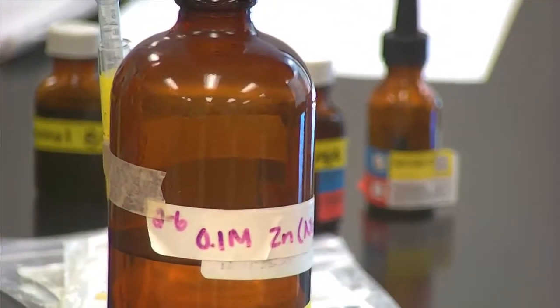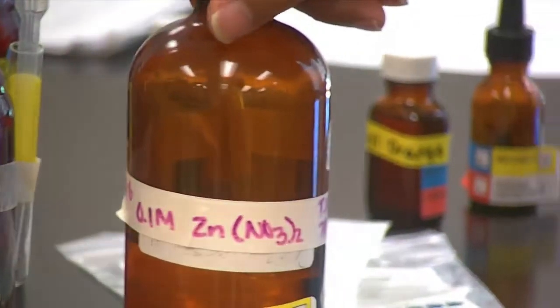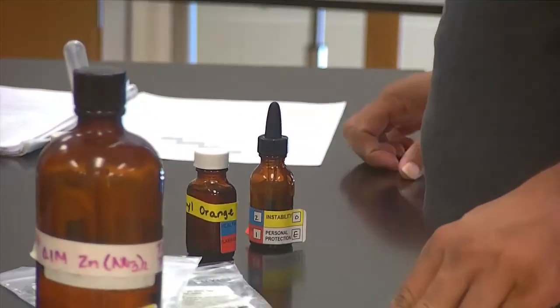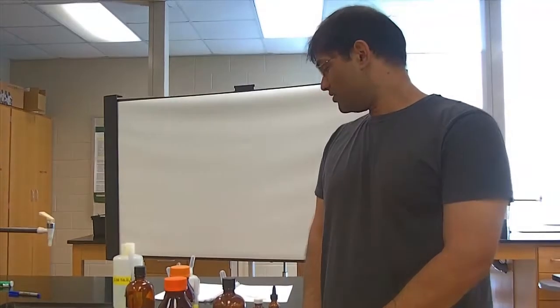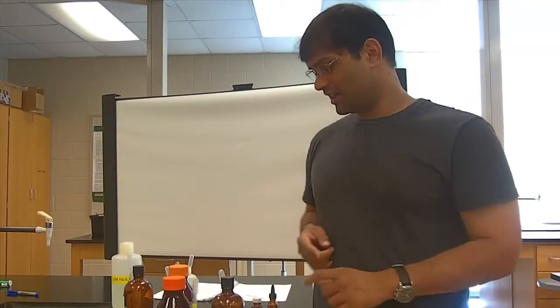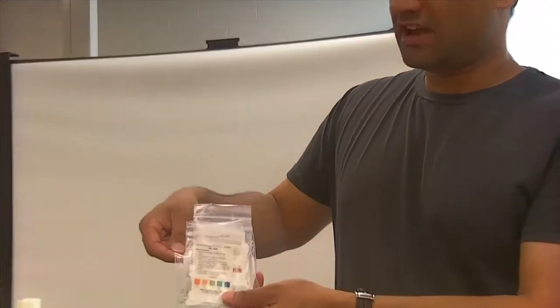What's also interesting in this lab is you're going to be measuring the pHs of metal nitrates: aluminum nitrate, zinc nitrate, and, not shown here, ammonium nitrate. Believe it or not, these are also acidic, which means they can give off a proton. Some of the other household items that you will measure the pH of, according to your table, are deionized water, tap water, and carbonated water. You'll have a whole spectrum of chemicals that you'll measure the pH of, primarily using 3 techniques. Once again, it's the pH meter, using the pH strips, where you and your partner will have to decide which pH strip and which range you'll want to use.